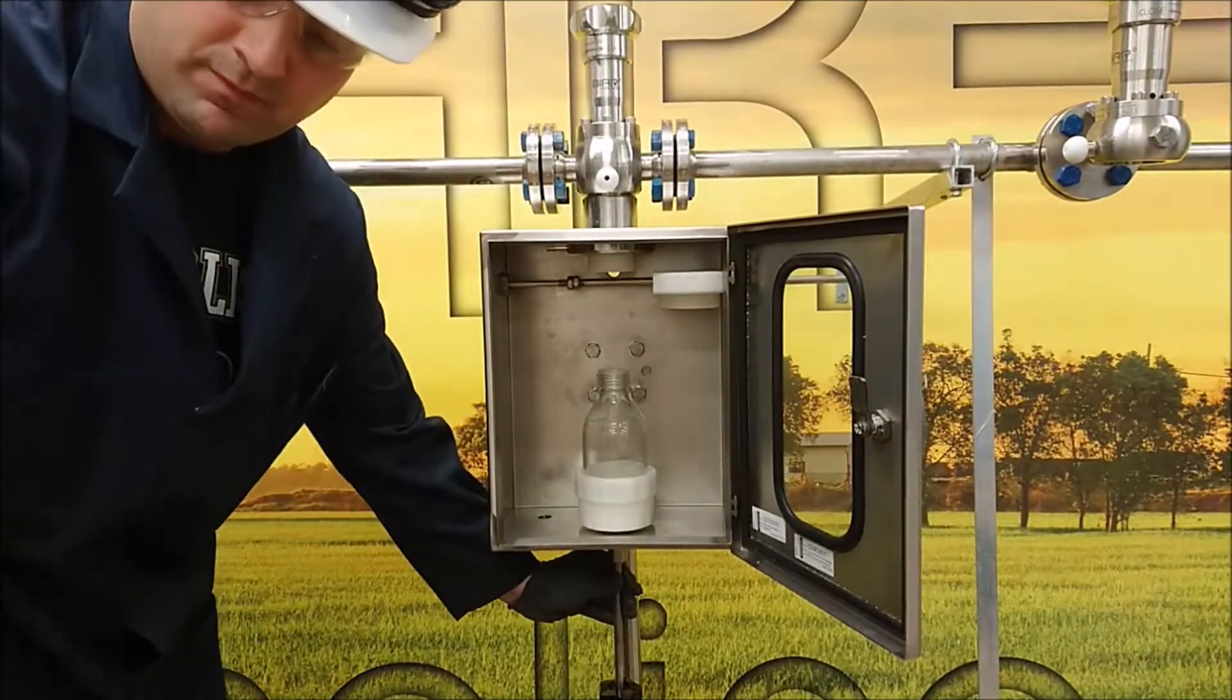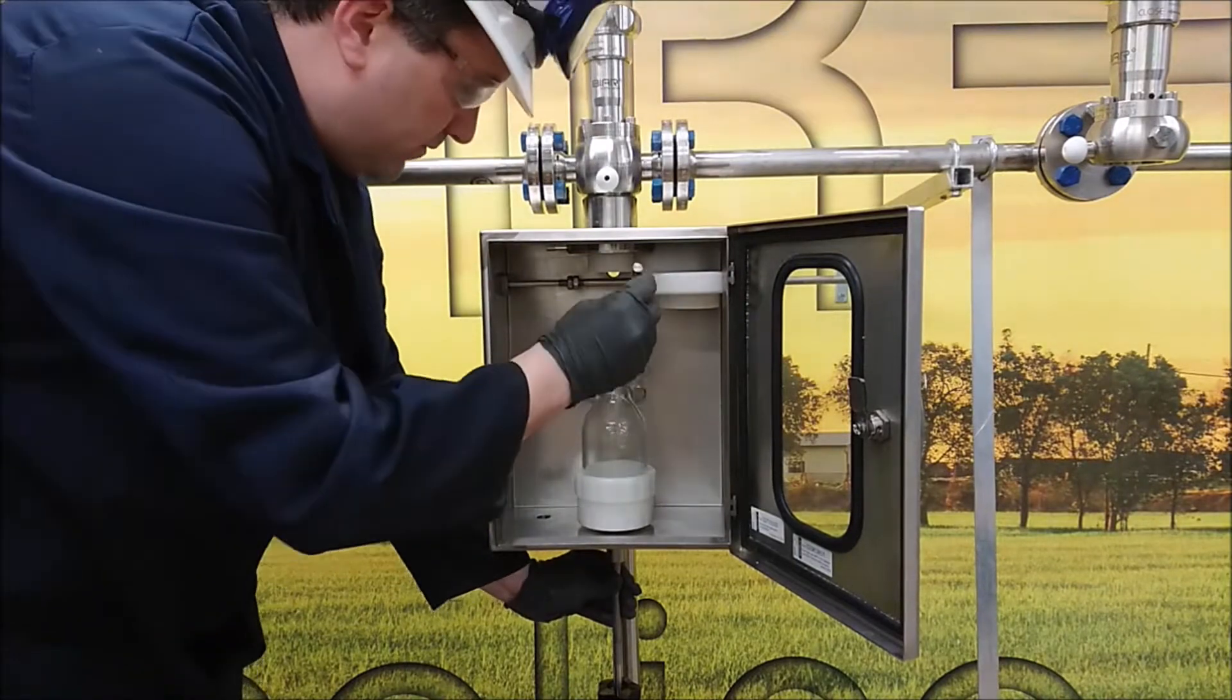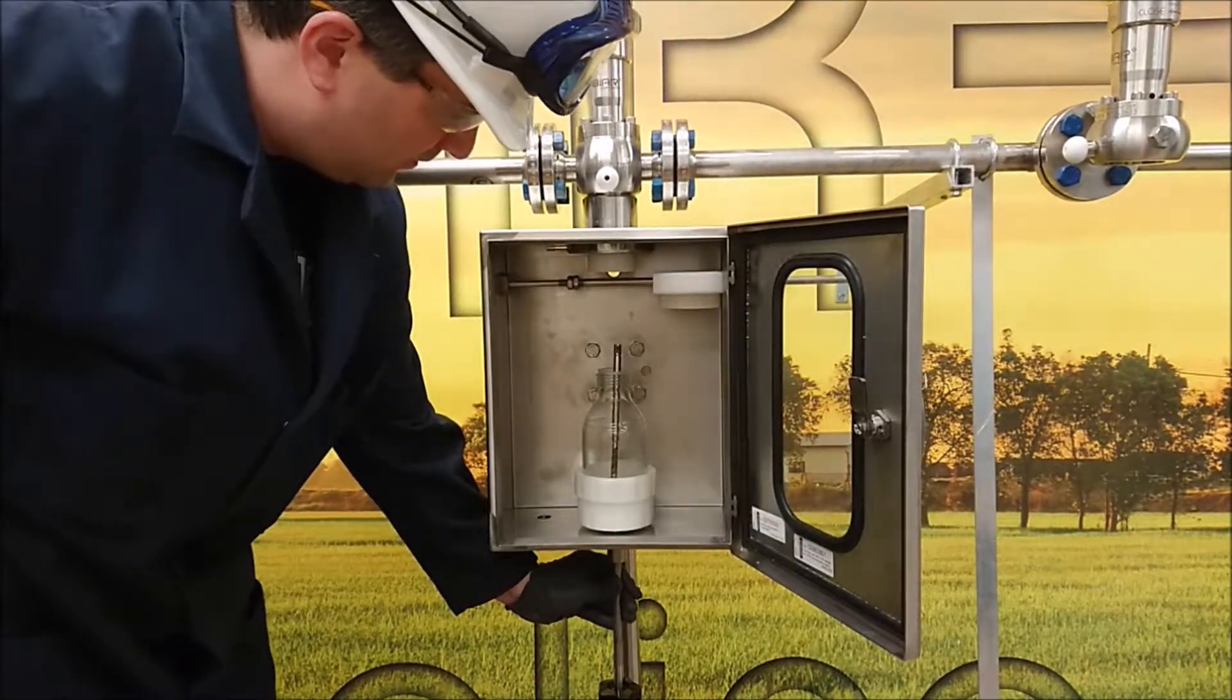He can now open the door. Once the door is open, he can perform his tests: temperature and specific gravity or density.